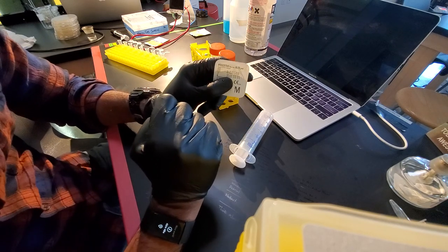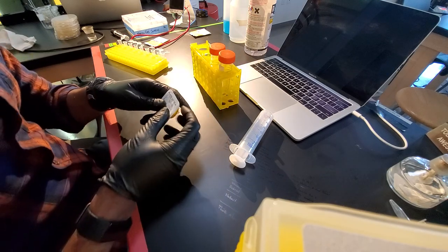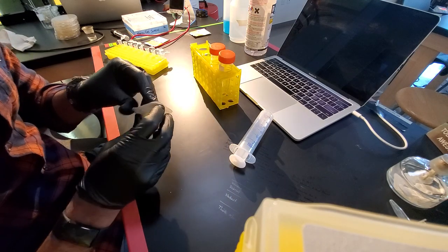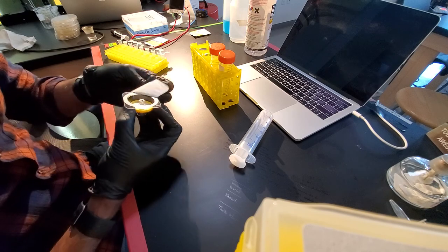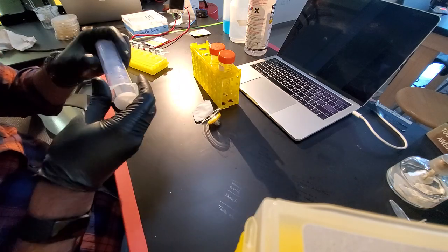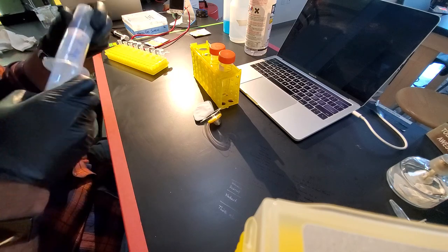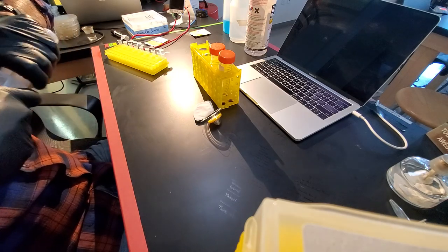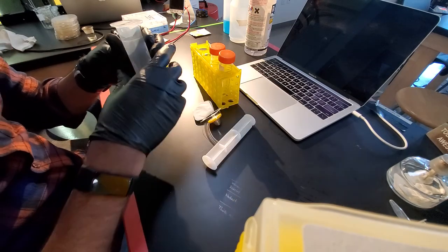That's, again, one of the most important aspects of this. So this can get a touch messy, so you have to be a little careful. I'm going to go ahead and pop this open. Okay.